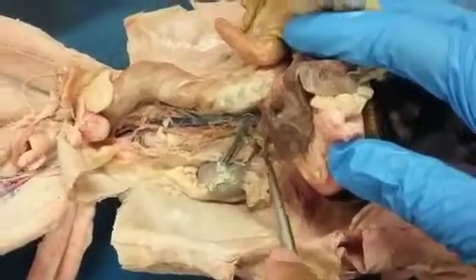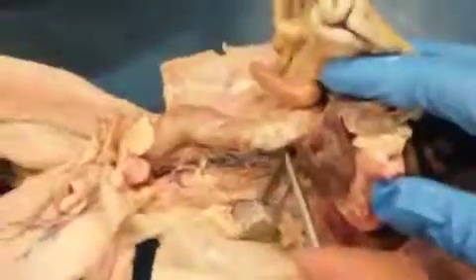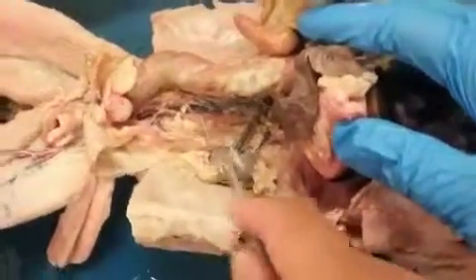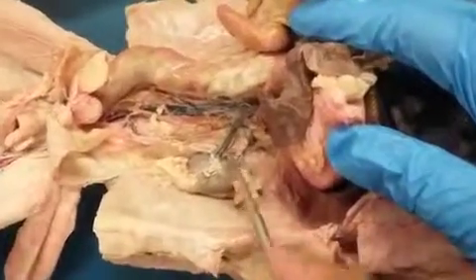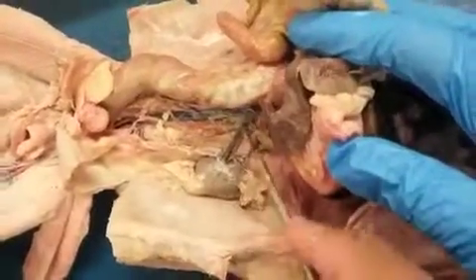Do cats not have two kidneys? Yeah, they do. We just didn't expose the kidney on the other side. And it doesn't drain into the kidney, it drains into the renal vein, yeah. Right? Okay. Because this blood that's in the renal vein has already come out of the kidney, right? Meets up with- yeah, leaving.